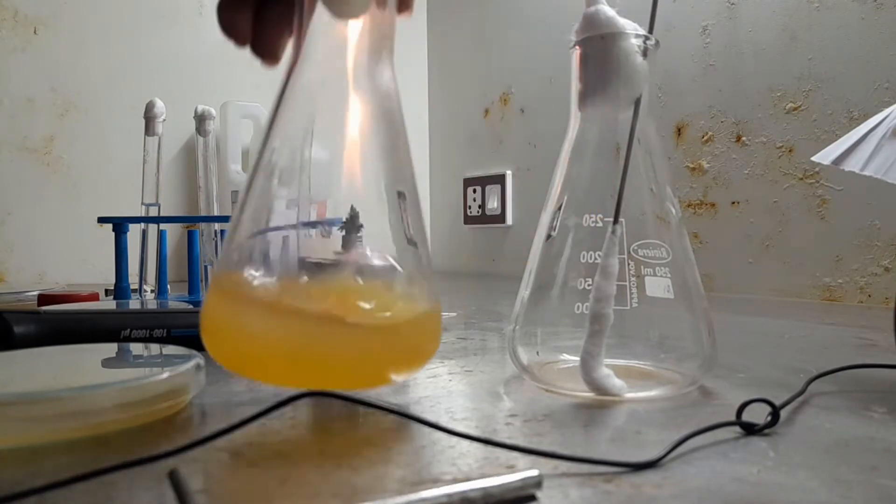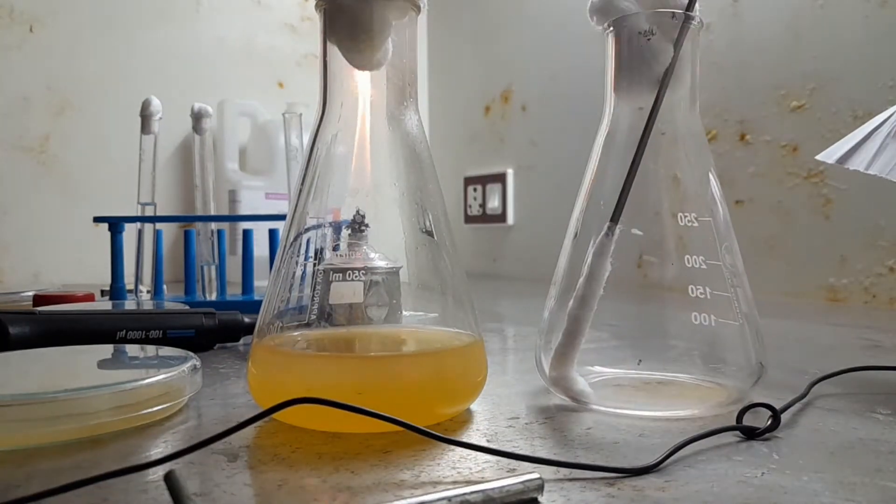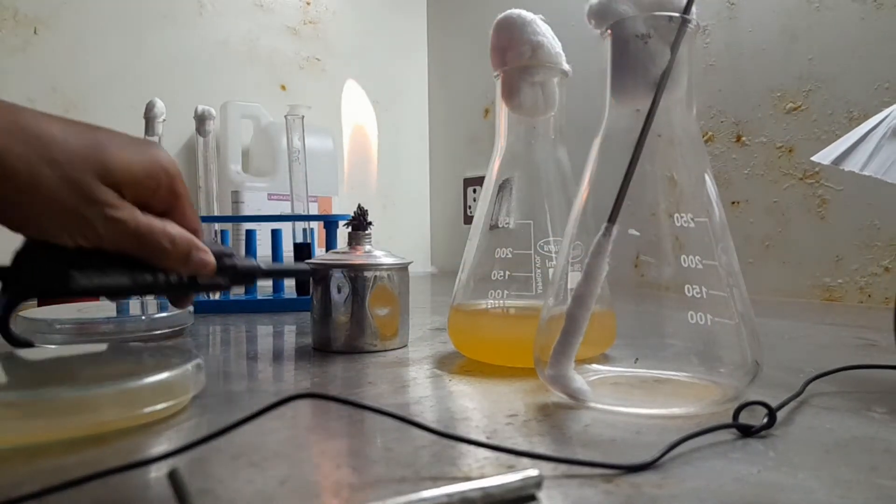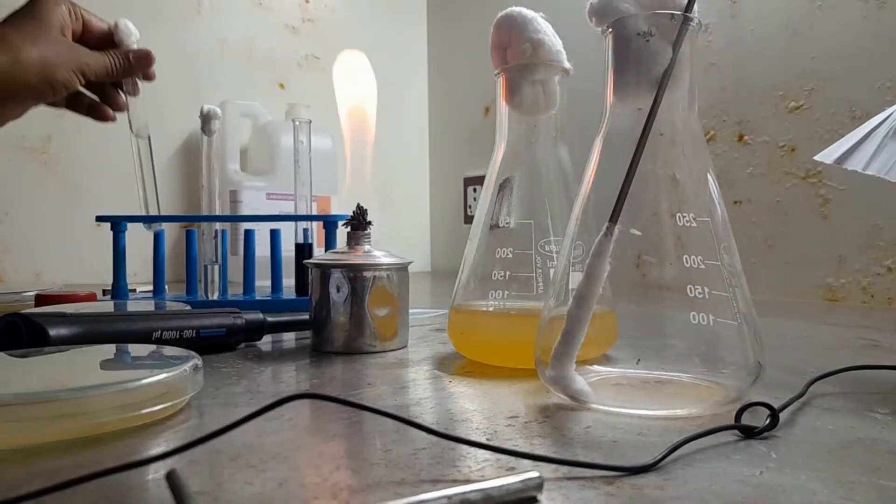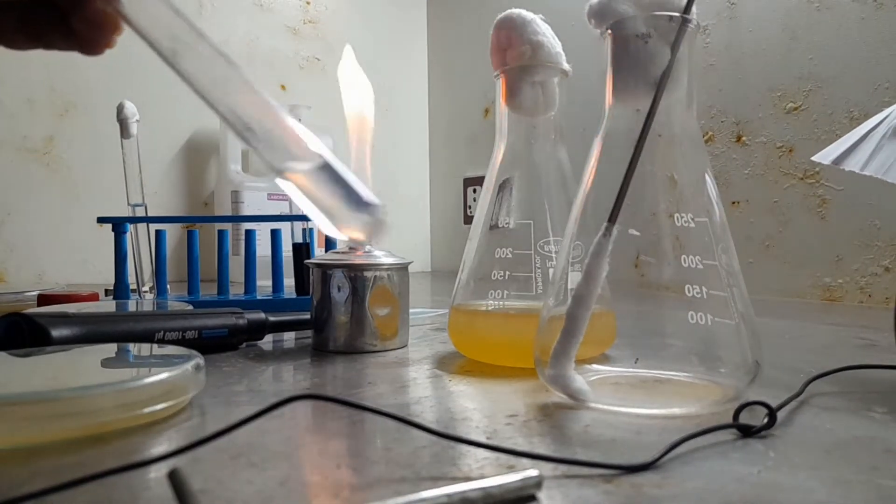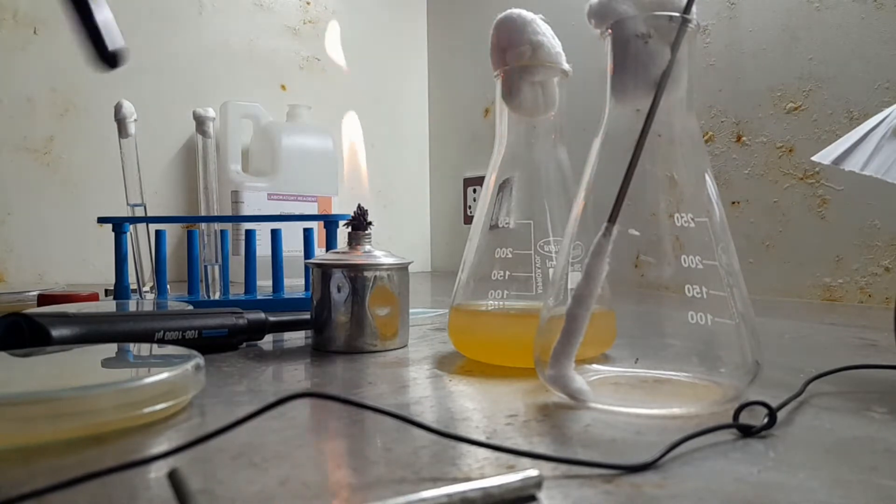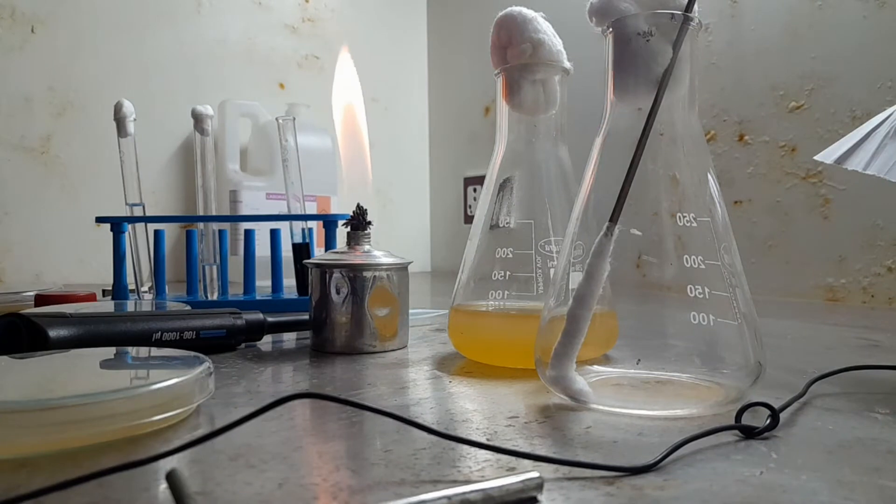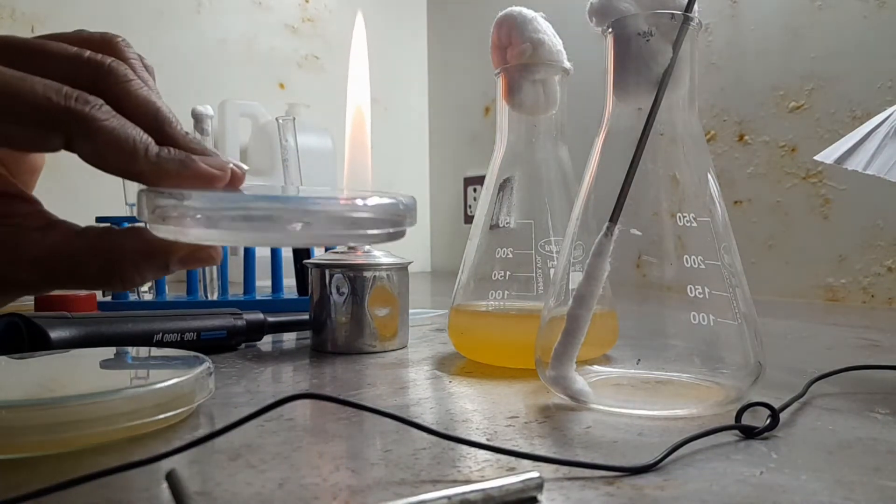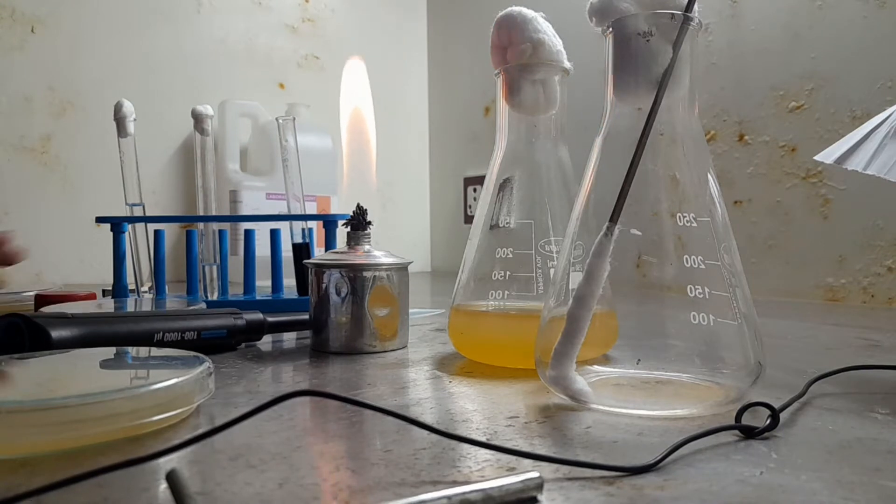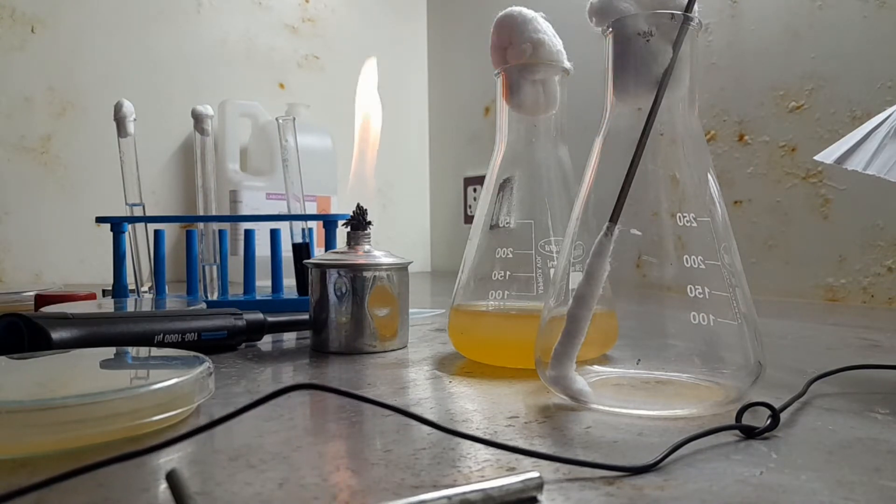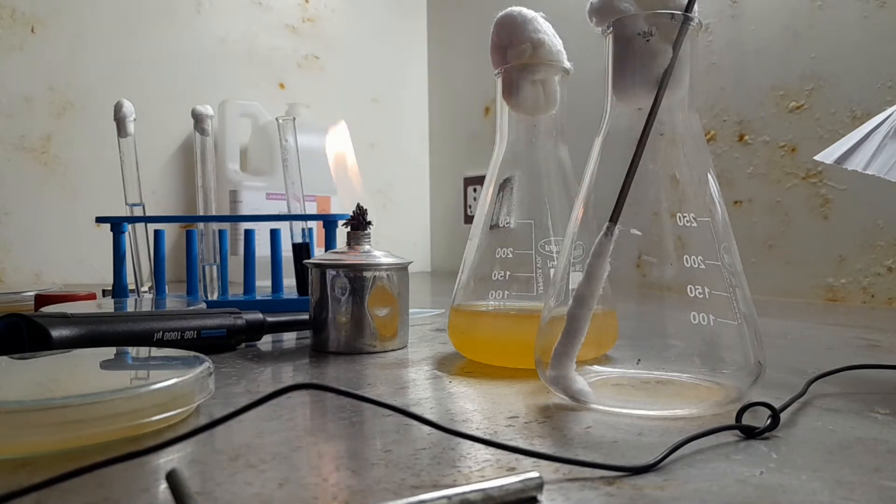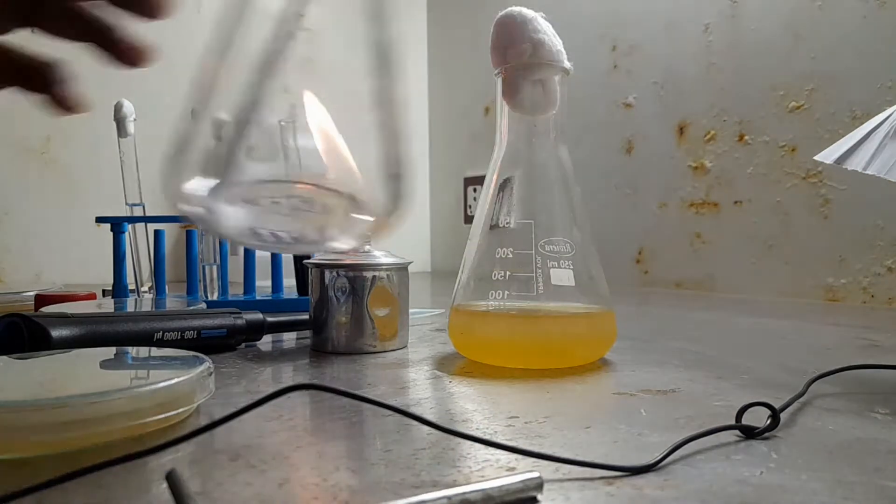We have overnight culture, a sterile swab, micropipette, micro tip, and antimicrobial solutions—maybe streptomycin or tetracycline—and this is plant extract one, plant extract two. We have Mueller Hinton Agar plate, sterilized plate, and we have alcohol in a Petri dish. All the necessary requirements should be kept on the table, well-prepared requirements should be placed.